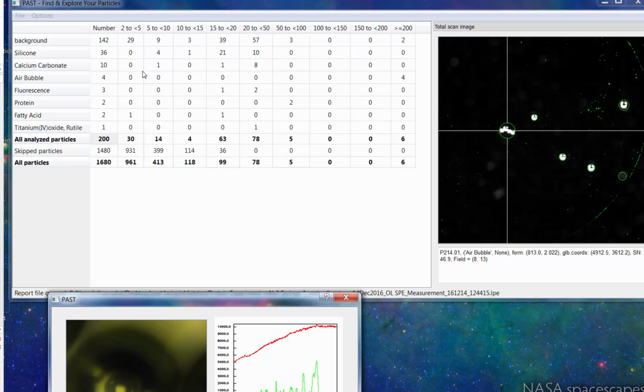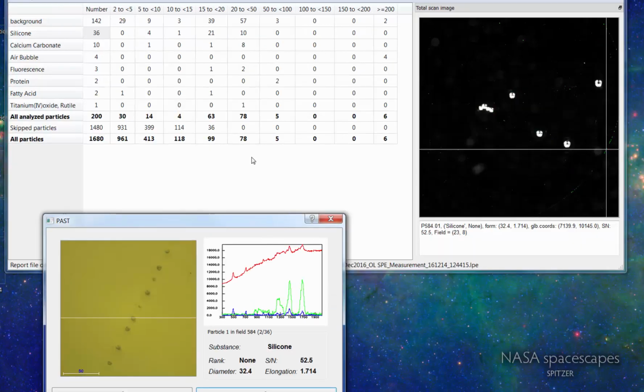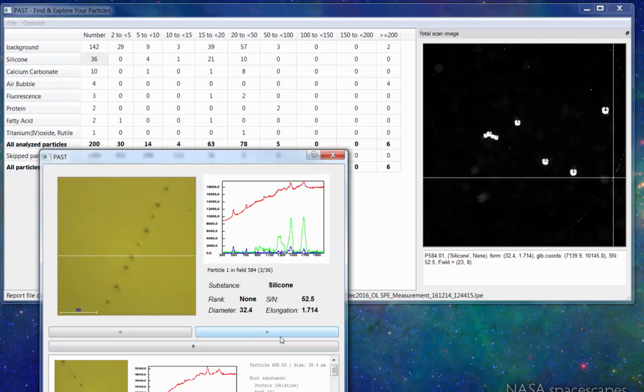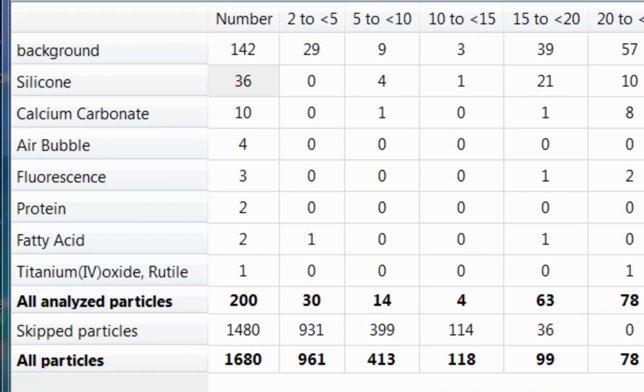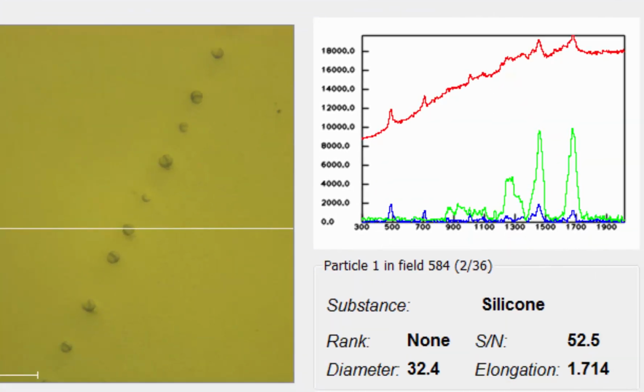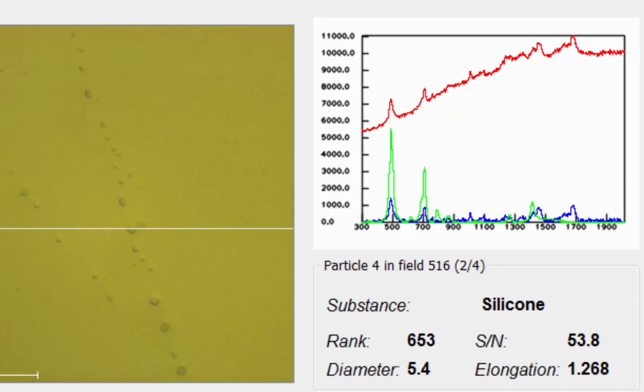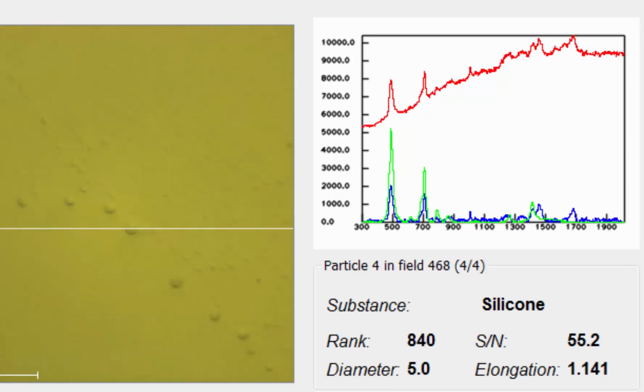Let's take a look at this example, because here this was a pre-filled syringe. Here you see the silicone oil droplet, and you can clearly see that those 2 peaks here at 500 and 700 are related to silicone droplets. Going down to the smaller ones, that's a 5.7 micrometer silicone droplet. This is 5.4, 5.2, and 5.0. So you can reliably find those silicone droplets, and you can even measure smaller ones.